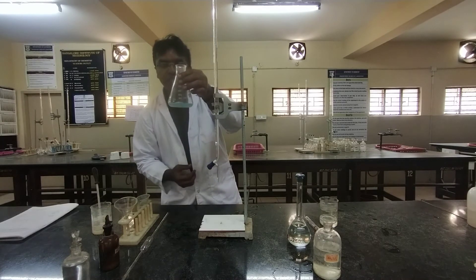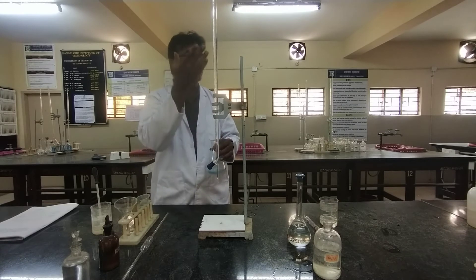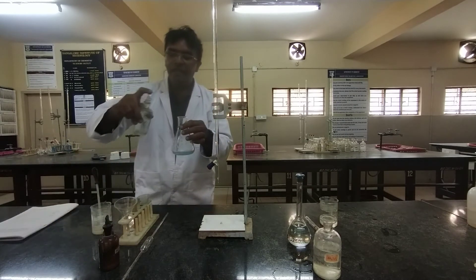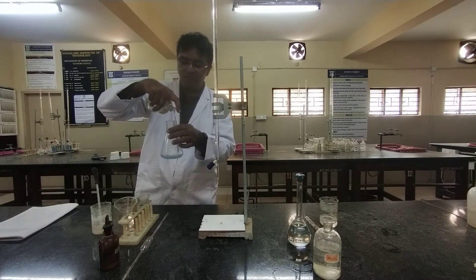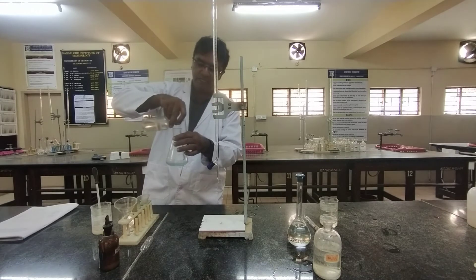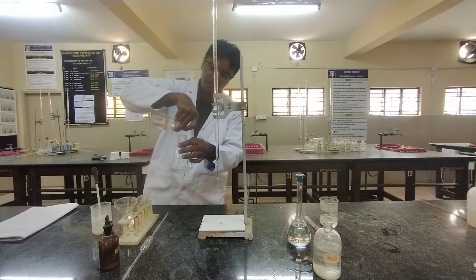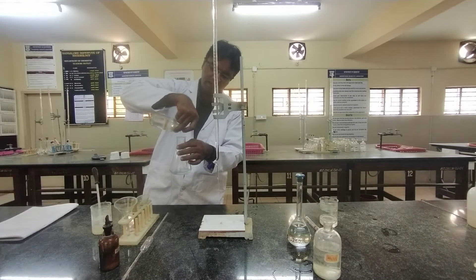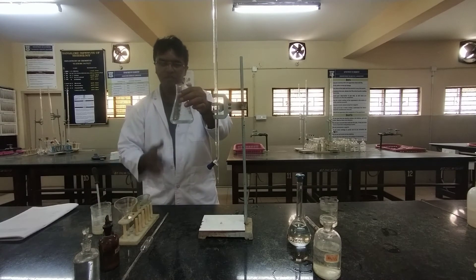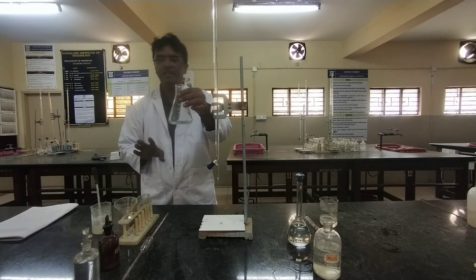Now the solution is basic, but iodometric titration requires an acidic condition. Therefore we add acetic acid until the blue color disappears, then add excess acetic acid — you can be lavish here, adding 30 to 40 drops — to properly maintain the acidic condition. At this point you have neutralized the excess nitric acid and maintained the acidic condition by adding acetic acid.